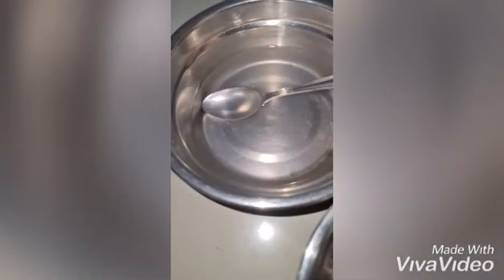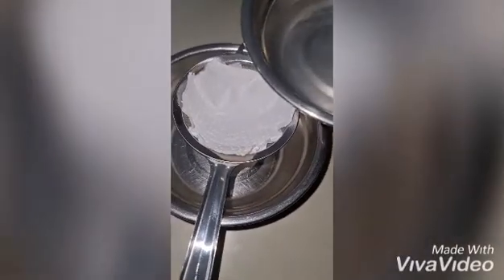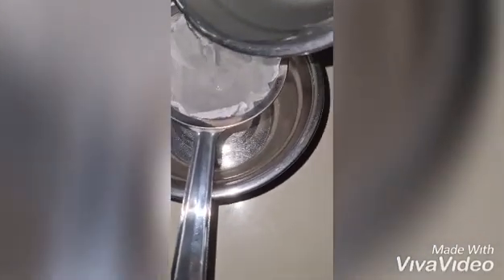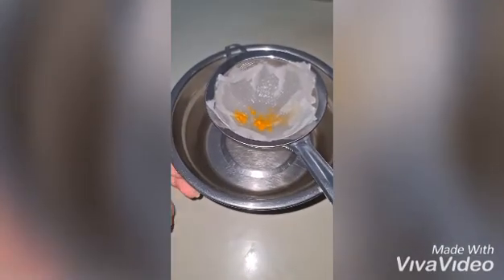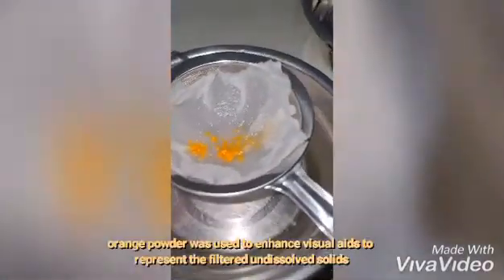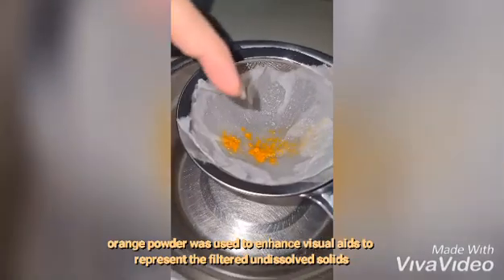After 5 minutes of heating, the ibuprofen has already dissolved in the solvent itself, and now I will use the filter to filter it. After 5 to 10 minutes of filtering, this is the filtrate that I've obtained at the bottom of the beaker, whereas this is the filtered undissolved solid.